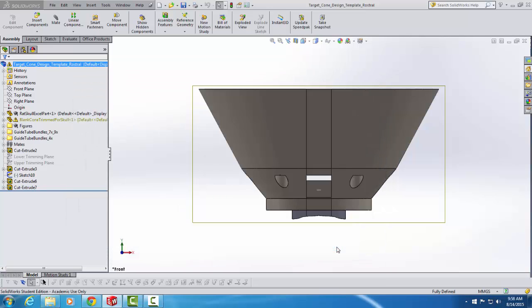Now I'll wait a moment for that to finish. And there, you see that the file name has changed. And you'll want to save a different file for each targeting cone that you design for different experiments. Now I want to draw your attention to this sub-window on the left-hand side, which lists all of the various subcomponents of the targeting cone template file.